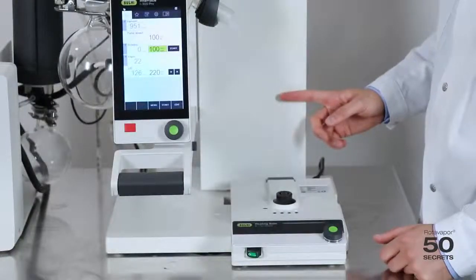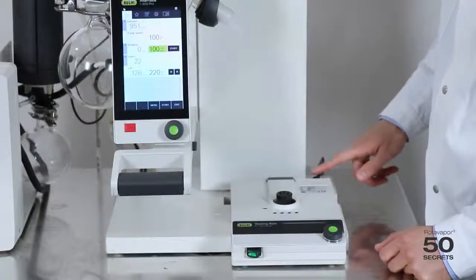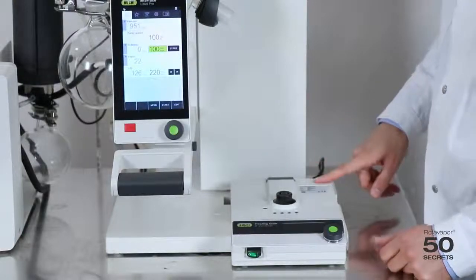For the freezing process, we first have to unplug the power cable of the B300 base.